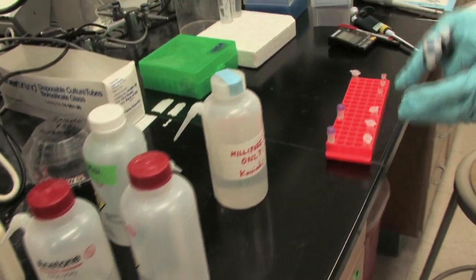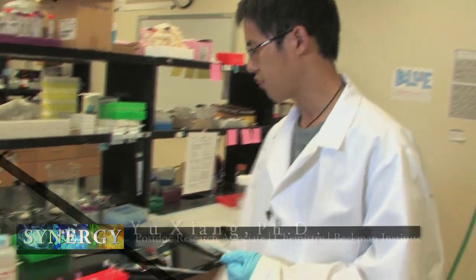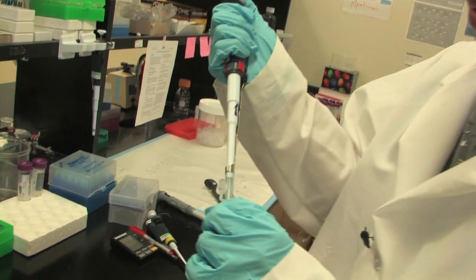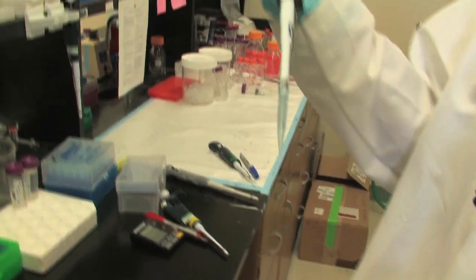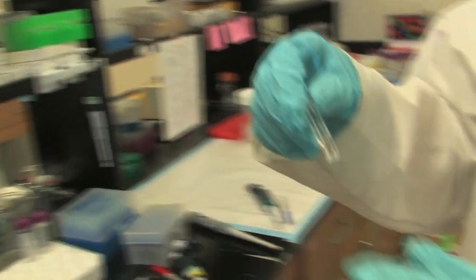What I will show is using fluorescence to detect the target by DNA. I have a few samples. We can first start with a sample without lead, and you will see the fluorescence signal is very weak. We put it in the fluorometer.